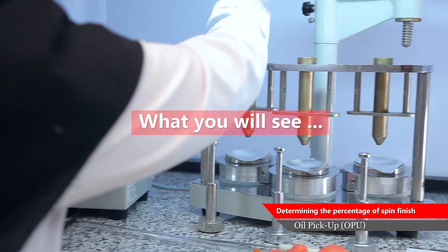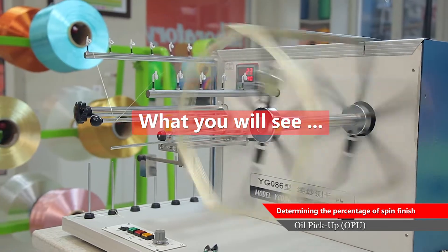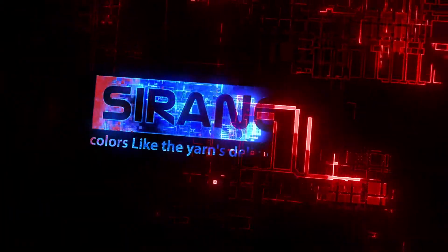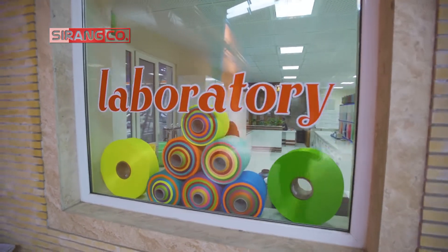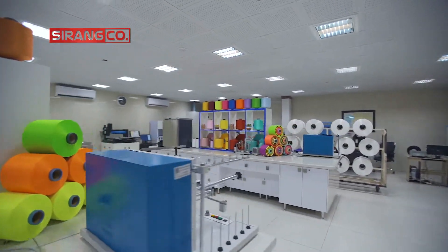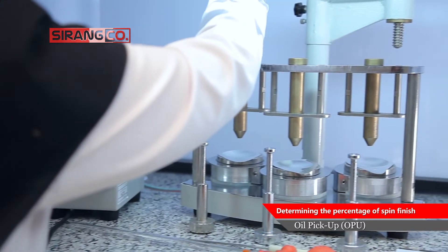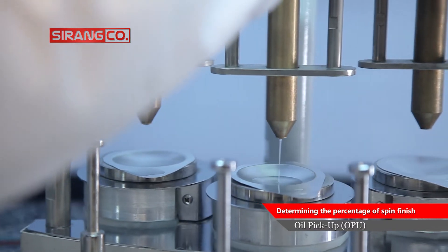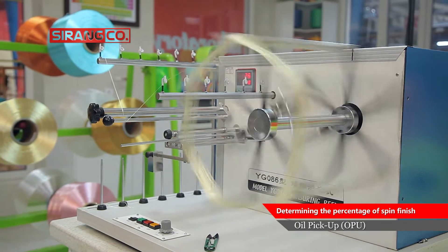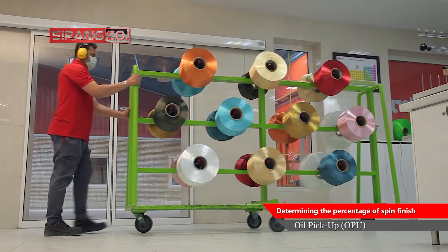Spin finish is a molecular layer applied on the surface of fibers in order to increase the anti-static properties and create adhesion between the filaments. It is one of the most important parameters affecting the quality of yarn. The percentage of spin finish on the yarn has a definite limit and should not be less or more than a certain amount.